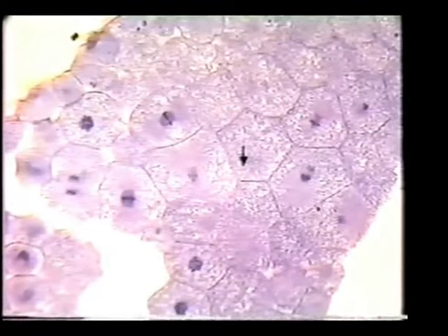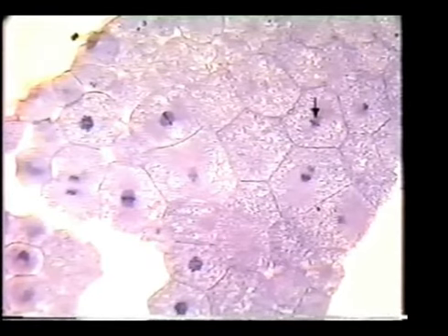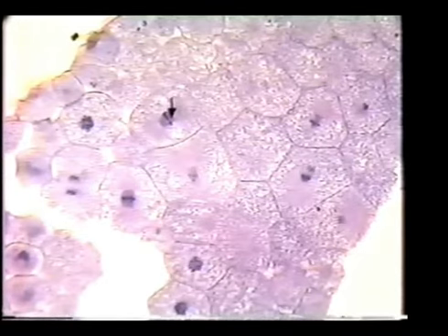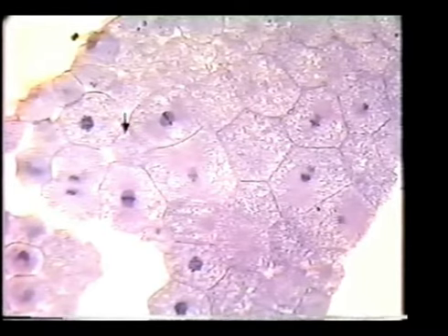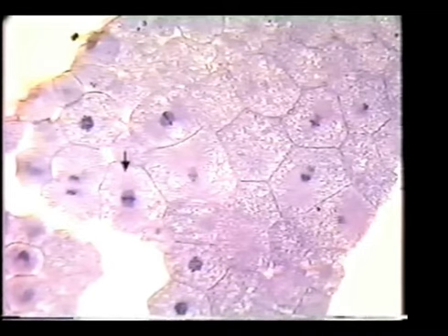In this view of some cells, we have several of them here in metaphase. This cell is in metaphase, and you can see the chromosomes lined up in a straight line here. Here's one where, again, chromosomes don't know up and down, so this line of chromosomes is rather diagonal. Here we have a cell in metaphase where the chromosomes are aligned straight across from left to right. These three cells are good examples of cells in metaphase.